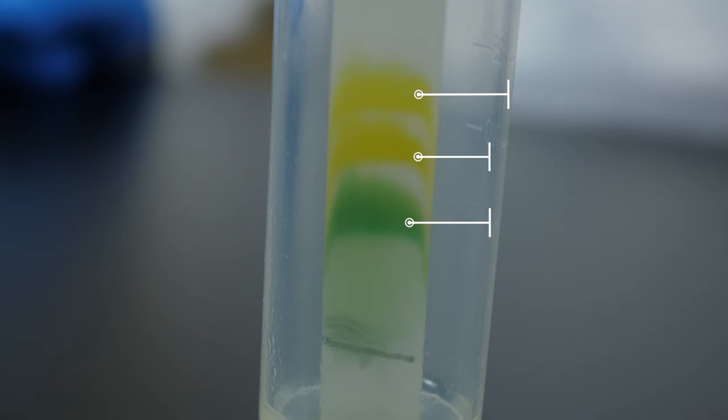By using chromatography, we have separated the plant pigment mixture into its three component pigments. In our next two labs, we will be working with a microscope as we explore the world of cytology and microbiology. At this time, proceed with the corresponding activities.